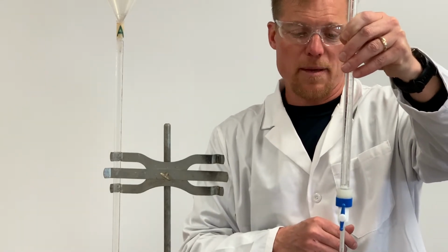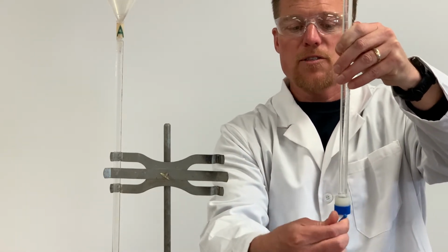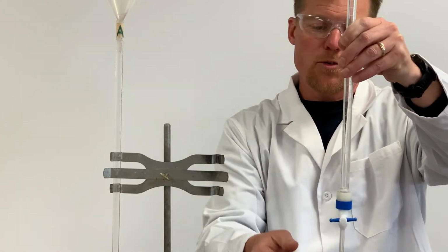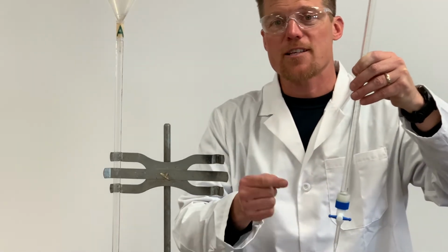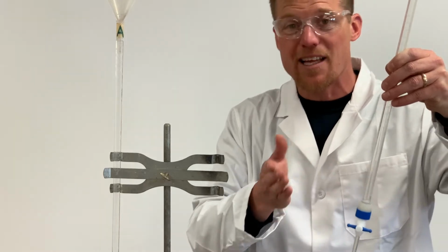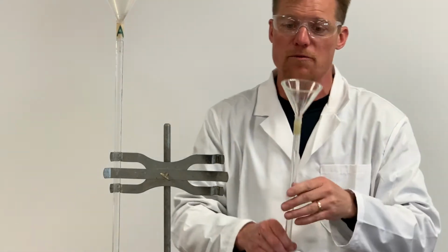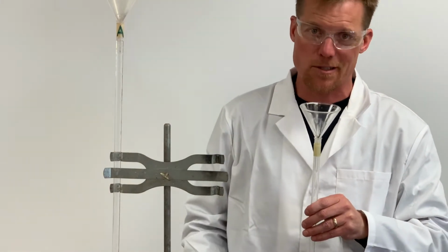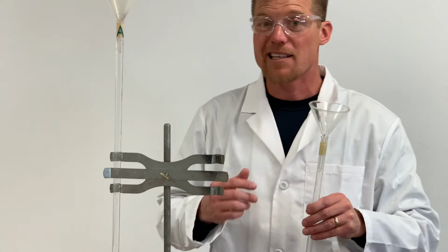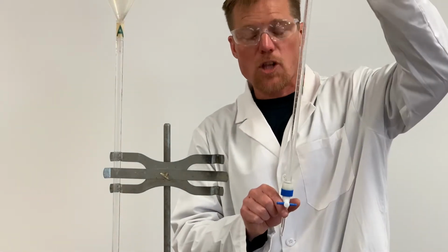I get flow coming out of my burette. Of course, you can vary that rate of flow as you turn the stopcock, all right? And you'll do that a little bit more later with me. But make sure the stopcock is closed unless you want to look like you peed your pants. Not a good idea. I've seen some kids go filling up their burettes like this, stopcock's open, and they're getting some solution on their pant legs. Not good if it's an acid or a base as well. All right, so stopcock is closed.